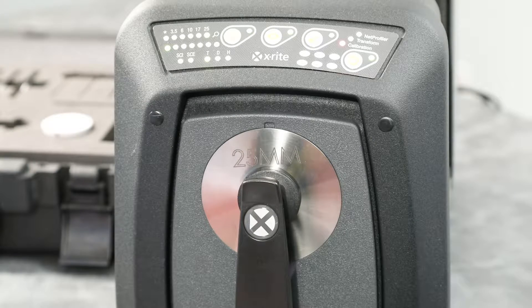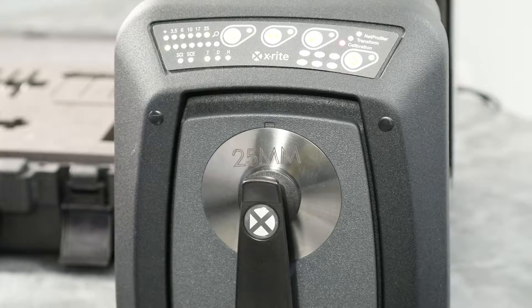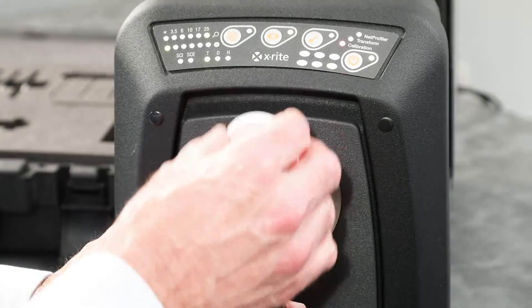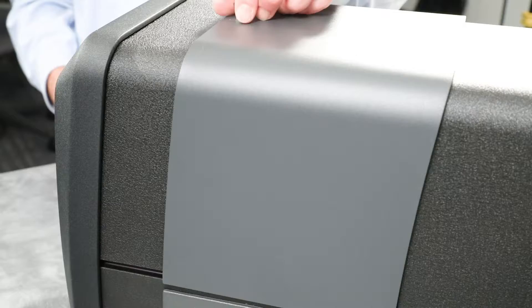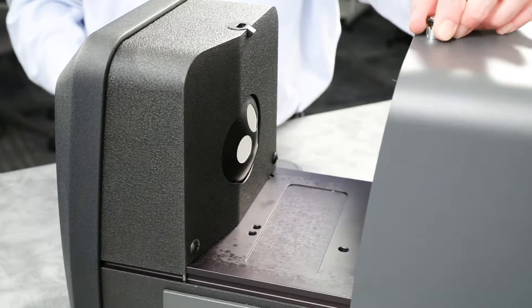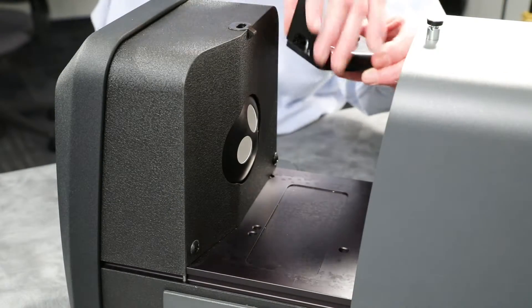Start by positioning the transmission white plaque on the sample holder so it is facing your aperture port. Open the transmission cover by lifting up on the locking pin while sliding the cover to the back.